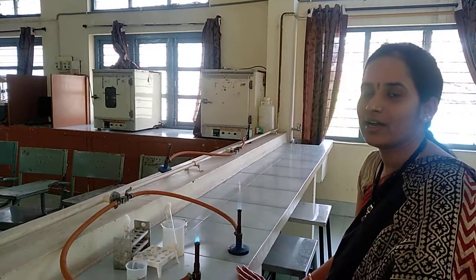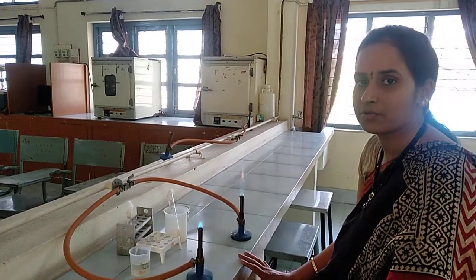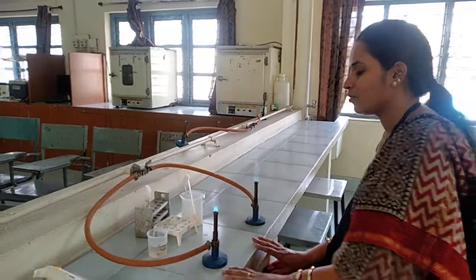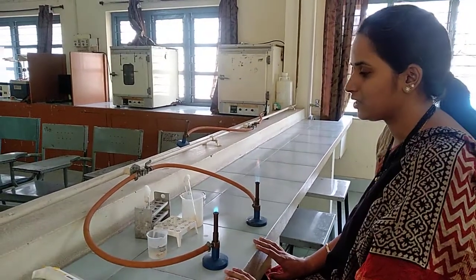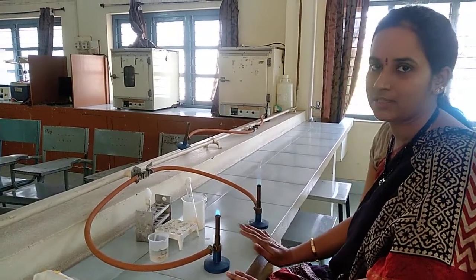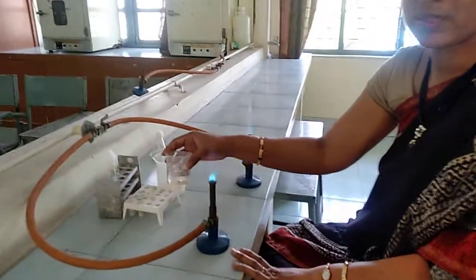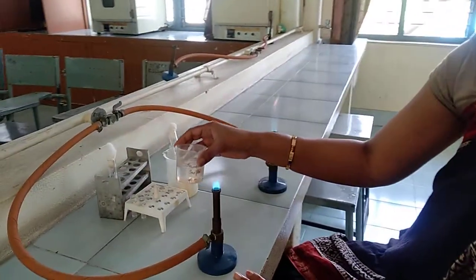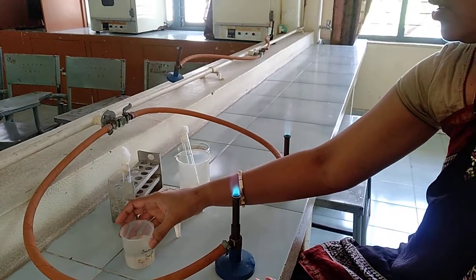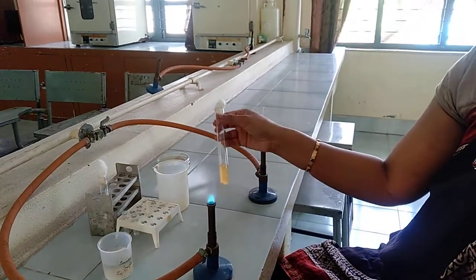Hello students. Now we will see how to isolate the bacteriophages from the sewage sample. Before going into the procedure, let us know what are the requirements for this experiment. First of all, we require the sewage sample which is the source of the bacteriophages, and also we require the host cell.